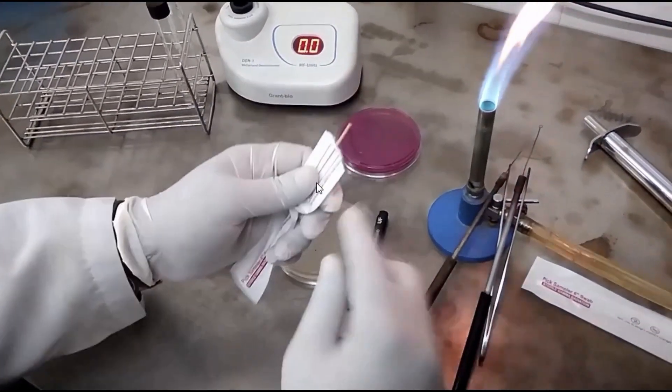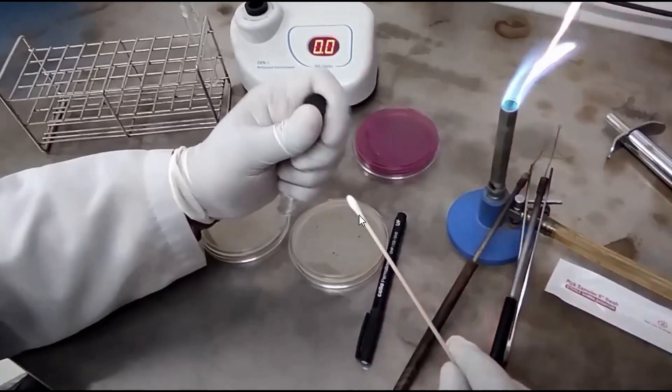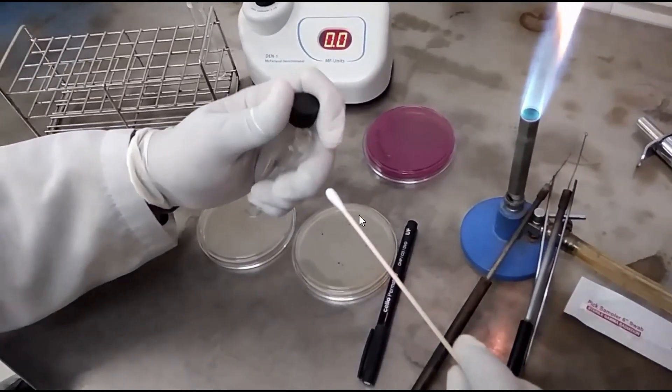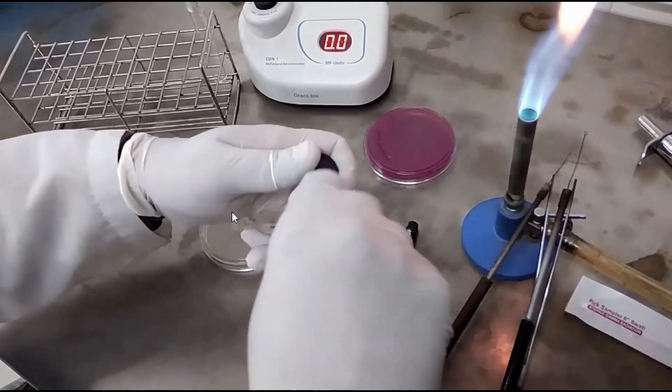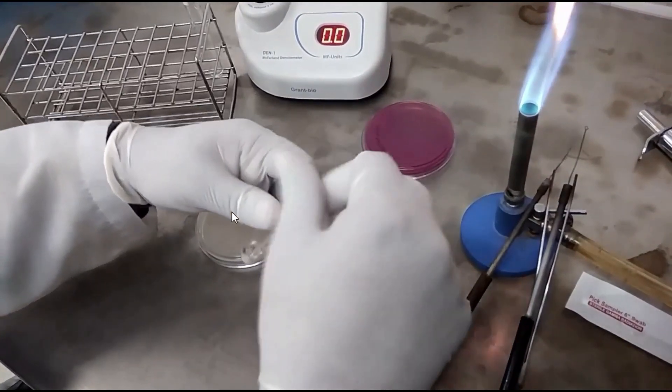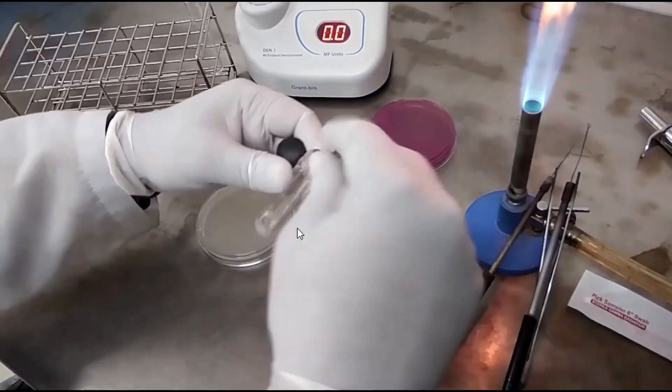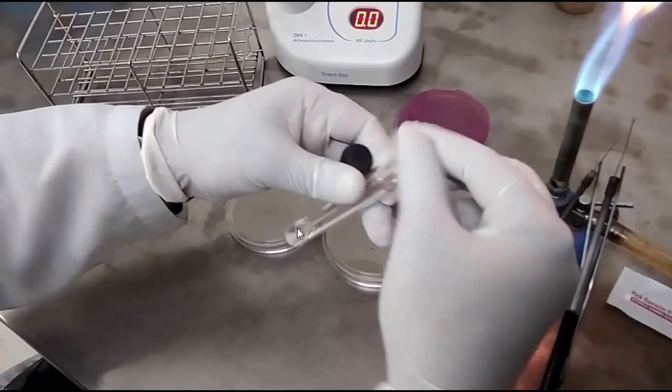So now, this one is a swab stick. Dip into this inoculum and rotate this way.